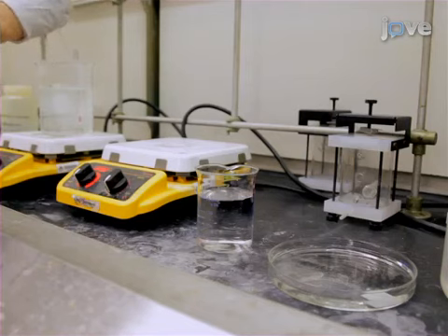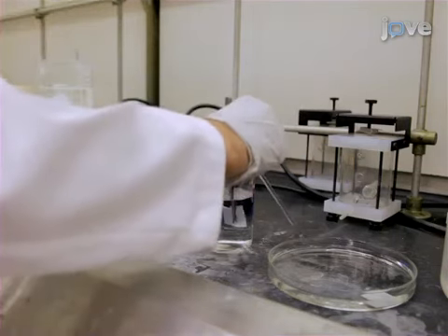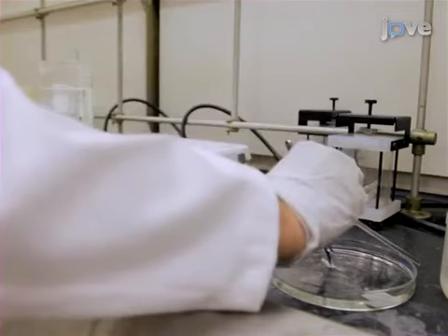After etching, neutralize the foils by dipping them in water and placing in one molar sodium hydroxide for 20 minutes.